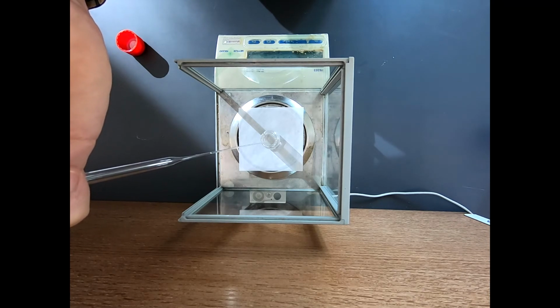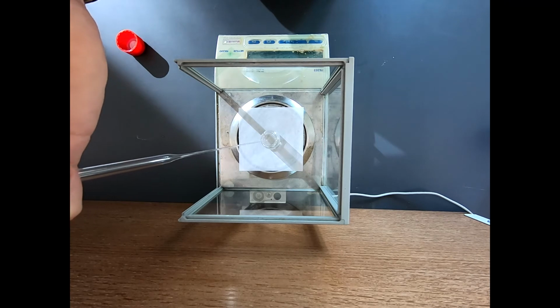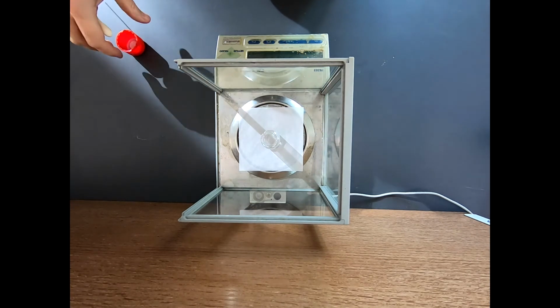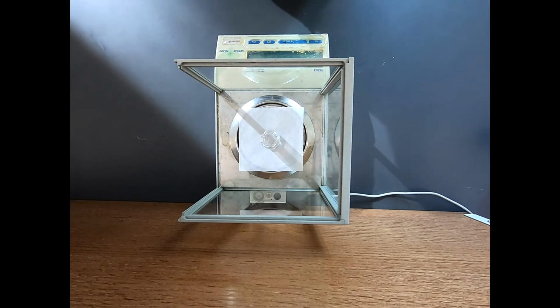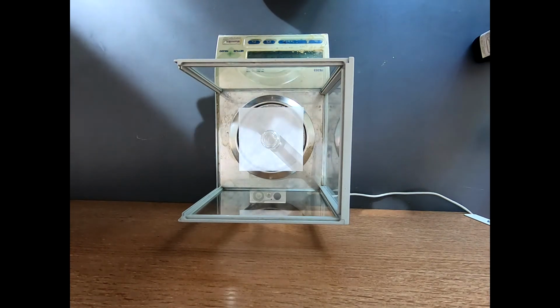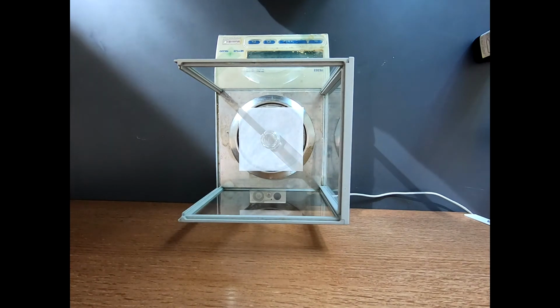A drop is about 10 to 20 milligrams. So let's try one more drop. And that is 588. Oh, why did I go over by that? Oh, well, anyway, it's 588 milligrams. We were at 573. So we will take this to the hood and set up the reaction.